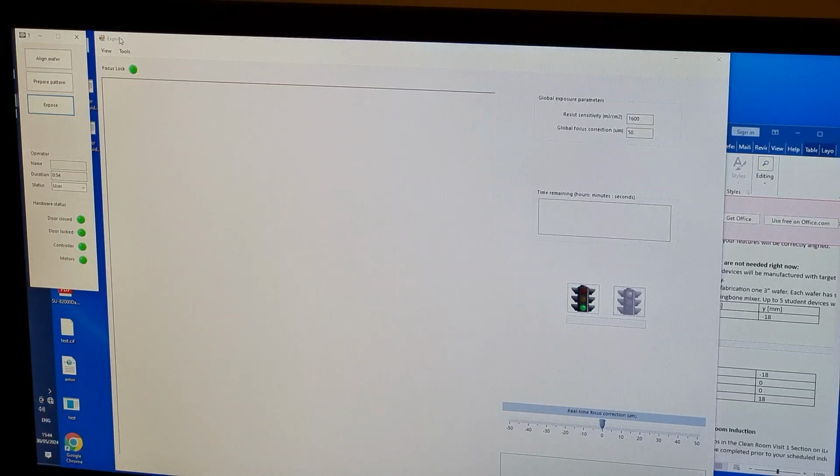The last window is for setting up the exposure. The resist sensitivity is the dose energy in millijoules per square centimeter and is always subject to some optimization. Global focus correction is the distance above the wafer surface that we want to focus the pattern. We have 2 layers of resist that are each about 50 microns, so we need a significant global focus correction. It is also sensible to do some optimization with this number.